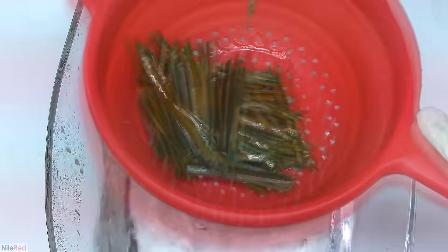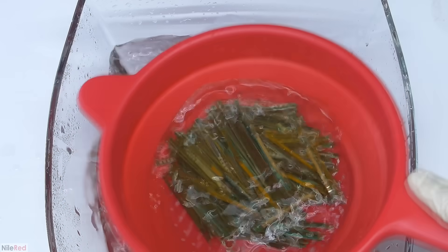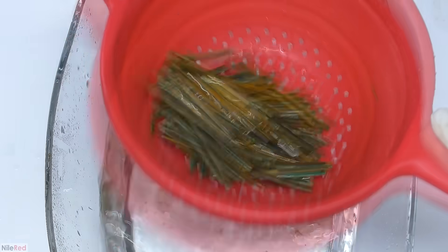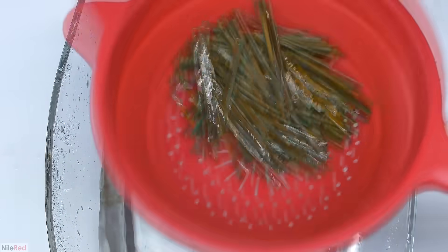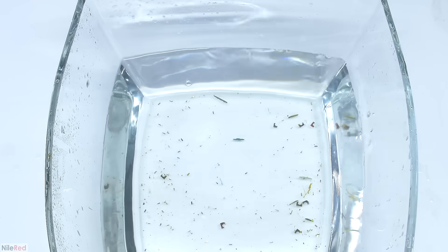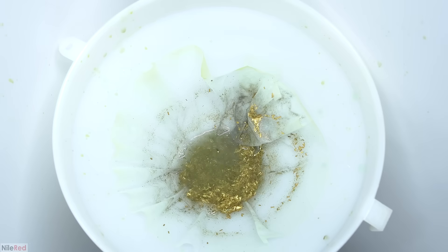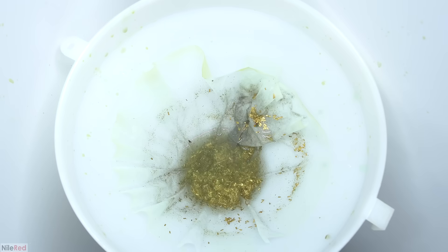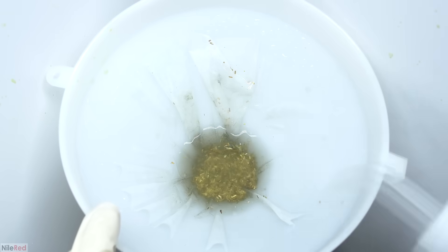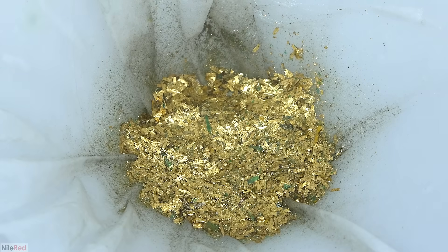The RAM trimmings were actually pretty clean prior to this washing so the yield is actually pretty abysmal. You might be able to see some RAM trimmings with a little bit of gold still left on them and these will be included in future batches. An entire trimming managed to make it through so I removed that, but you can see a lot of other debris also made it. Like before I used a beaker and scooped the liquid out and added it to the filter. Once everything had been added I washed the sides with a little bit of water to get all the gold down to the bottom, and we were left with a nice little bit of gold at the bottom.